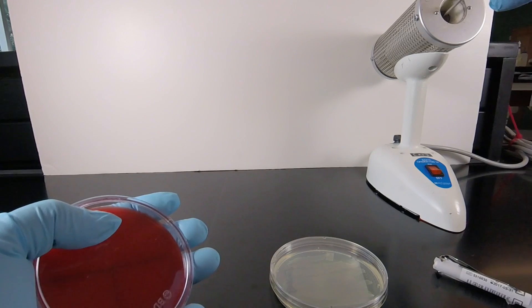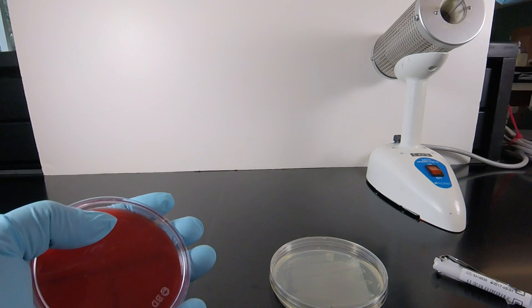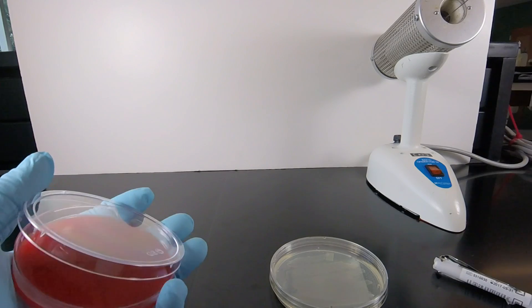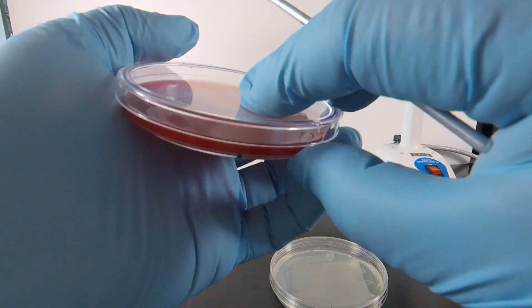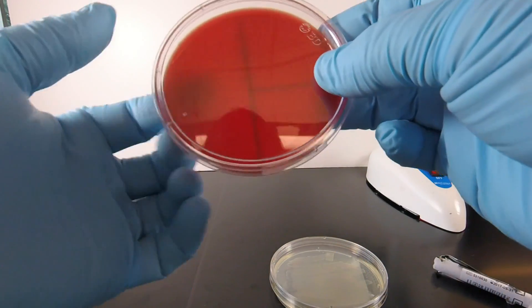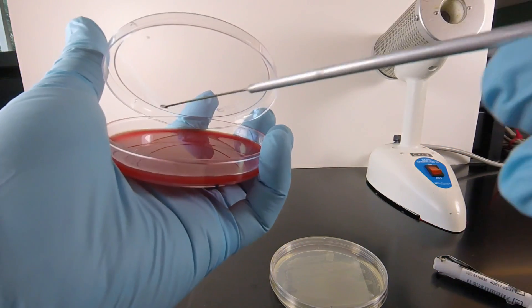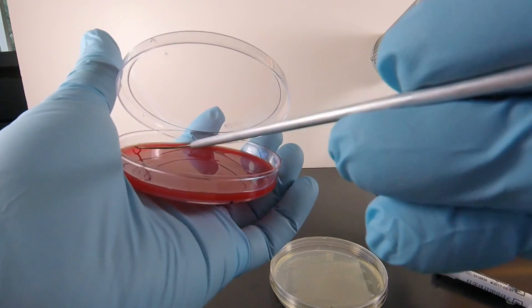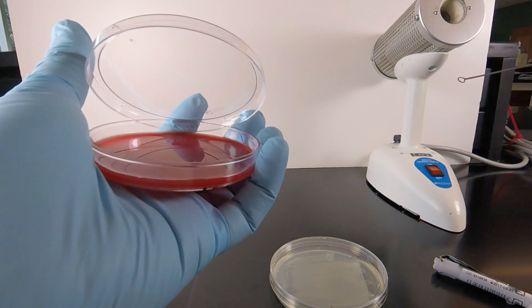After we cover Sector 1, we sterilize the inoculating loop for 10 seconds and stick it in the edge of the agar to cool. Now we rotate the plate so the bacteria in Sector 1 that are at 12 o'clock are sitting at 9 o'clock. We take our sterile inoculating loop, drag that through Sector 1 two or three times, and spread that out over Sector 2 without dragging it through after the first couple of times.